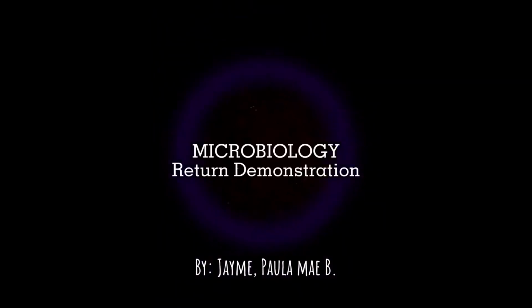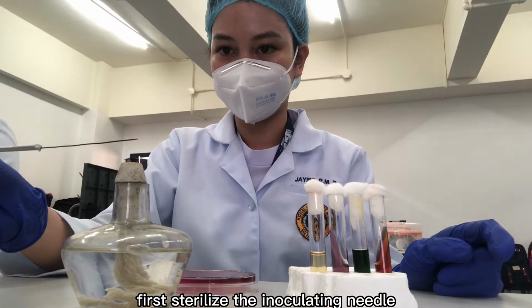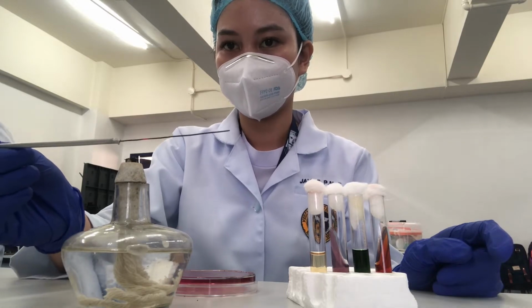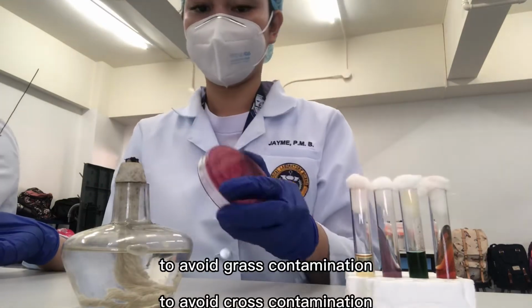3, 2, 1. The biochemical test. First, sterilize the inoculating needle. Pass the agar plate onto the flame to avoid cross-contamination.